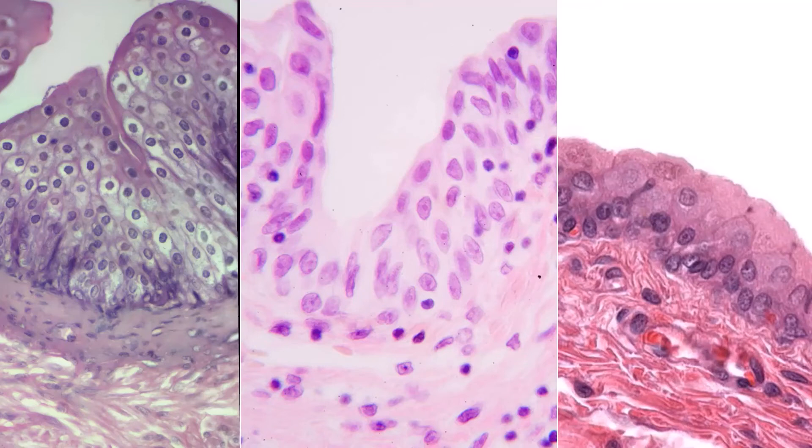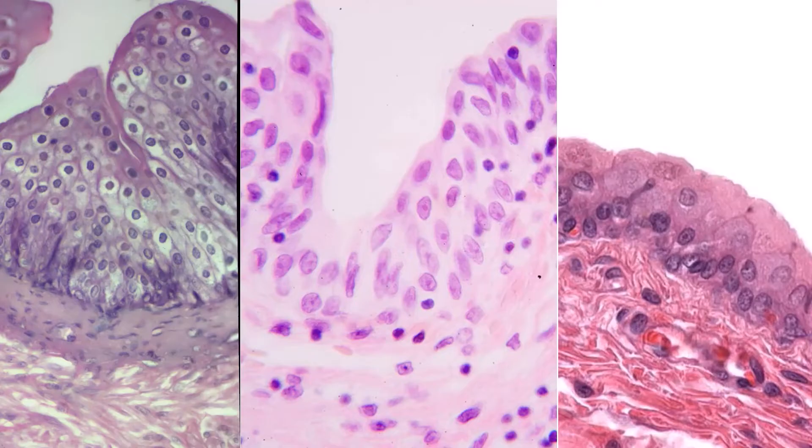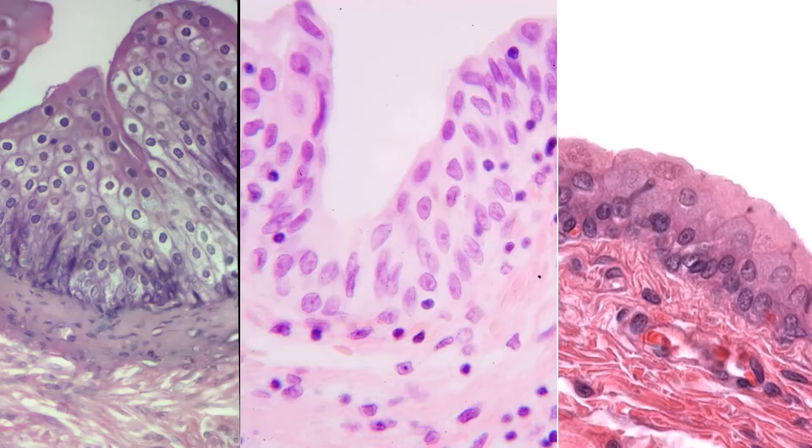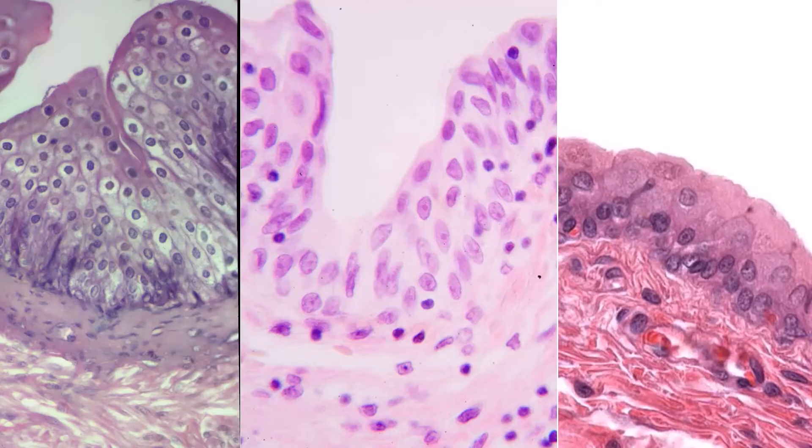A lot of students tend to have trouble with transitional epithelium more than any other epithelium, and I think that's because it can look very different depending on where the sample was taken from.